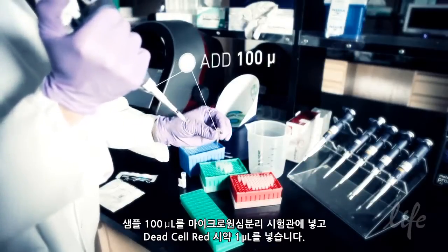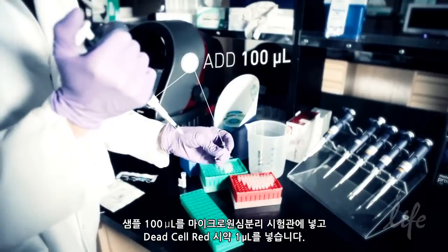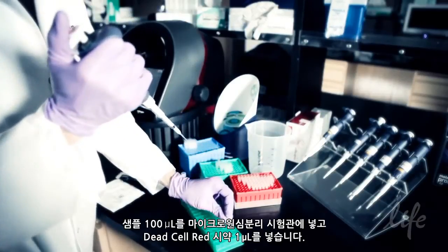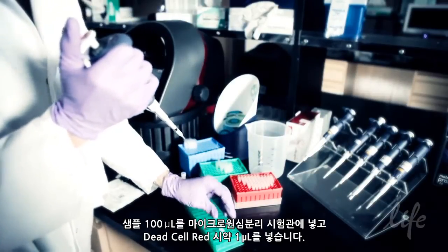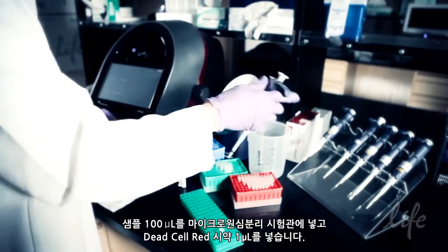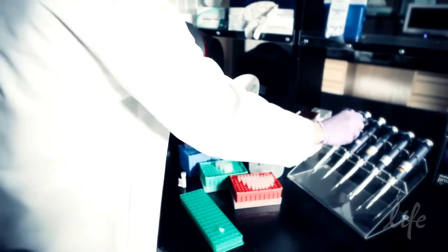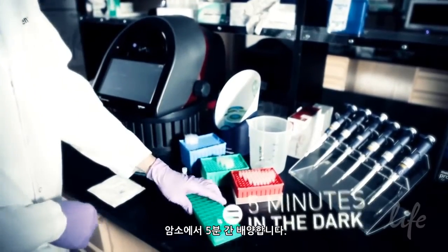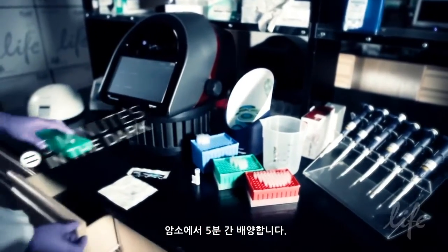Transfer a 100 microliter aliquot to a microcentrifuge tube and add 1 microliter of the Dead Cell Red reagent. Incubate in the dark for up to 5 minutes.